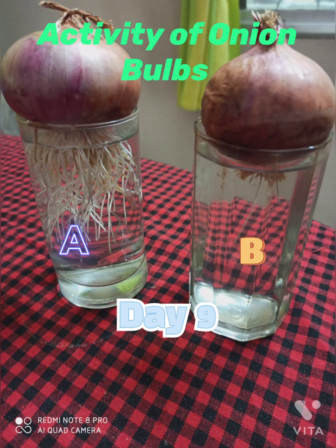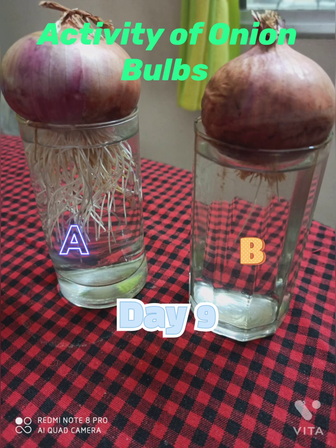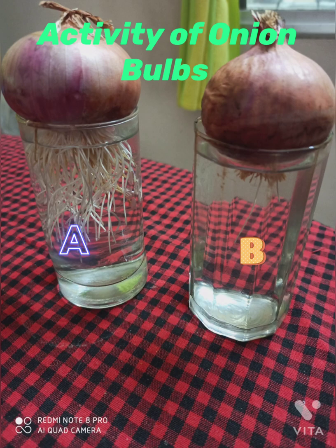Now this is day 9. As you can see, in beaker A the roots are emerging very fast and are now trying to touch the bottom of the glass tumbler, whereas in beaker B there is no growth as the root tips were cut.